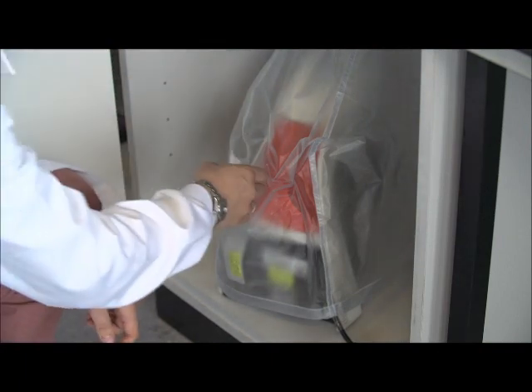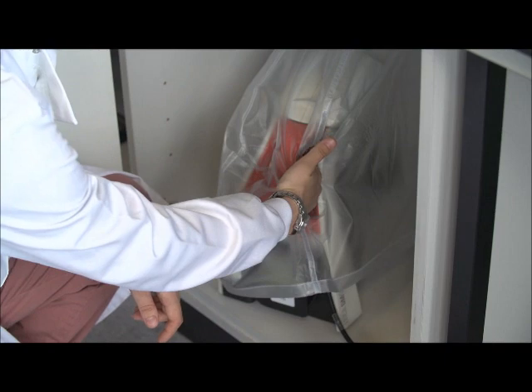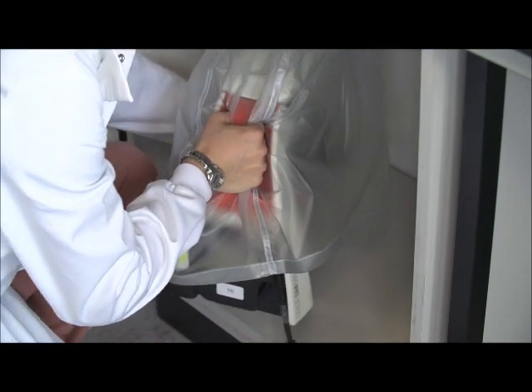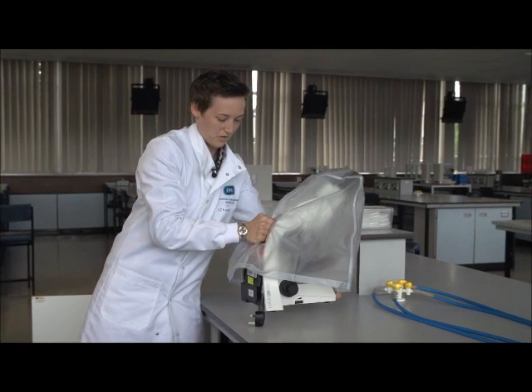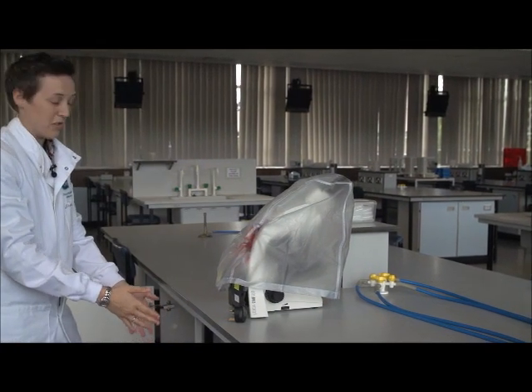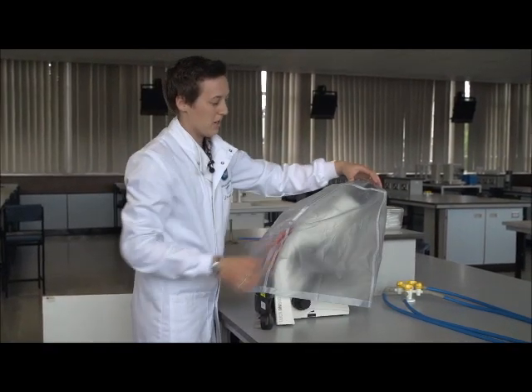The microscopes are kept in cupboards underneath the benches with the handles facing out. Pick up the microscope by the handle, pull it out until you can get your hand underneath the front base of the microscope. Then carefully bring it up and place it on the bench. Ideally, place it on the bench in front of a position where you can sit at it and use the microscope easily. You can then take the cover off.